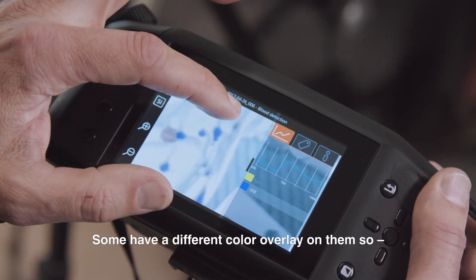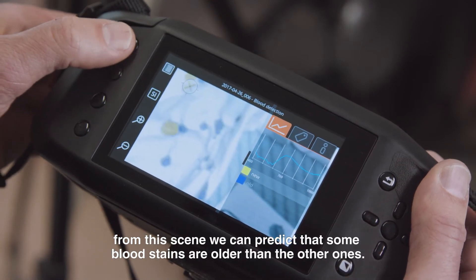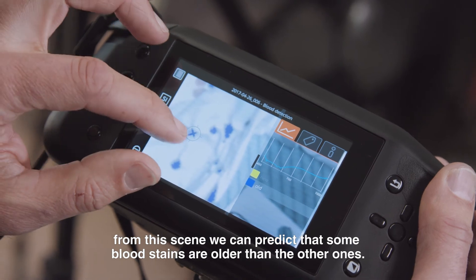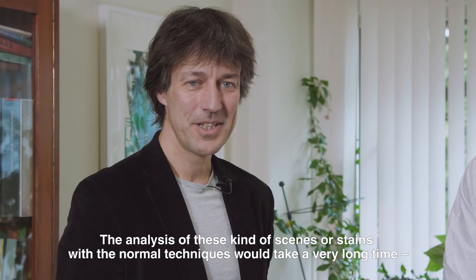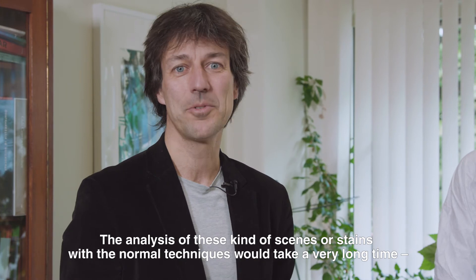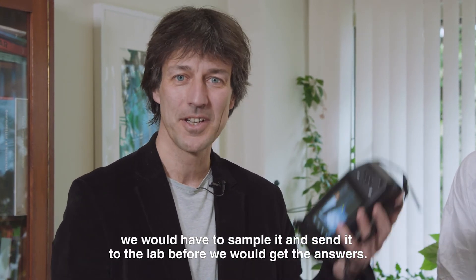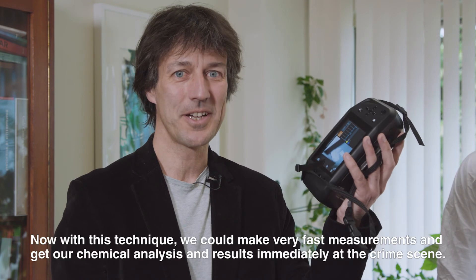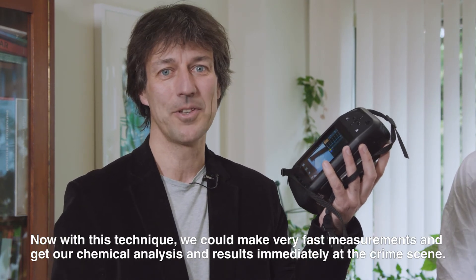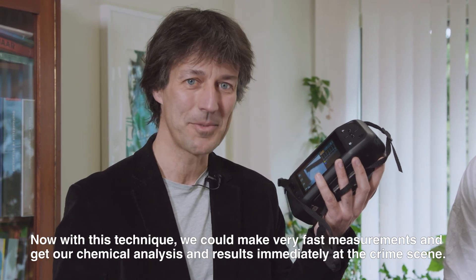Some stains have different colour overlays over them. From this scene we can predict — we can say — that some blood stains are older than the others. Analysis of these kinds of scenes and stains with normal techniques would take a very long time. We would have to sample them and then send to the lab before we get our answers. Now with this technique, measurements are very fast and we get our chemical analysis and results immediately at the crime scene.